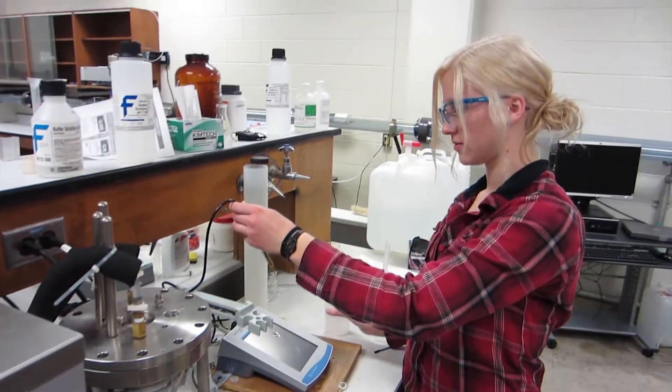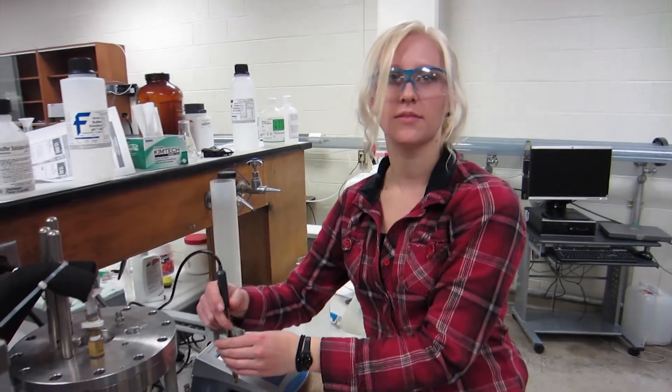Okay, so that's the calibration then for the pH meter. Is that right? That's right. Okay, great.